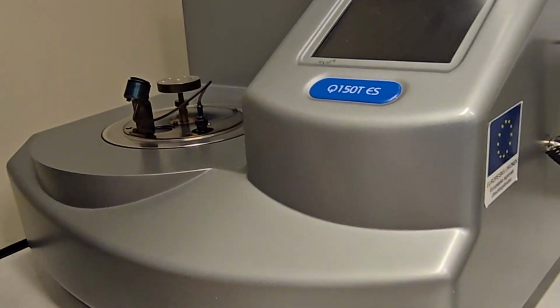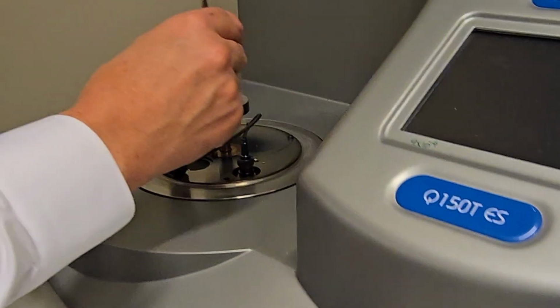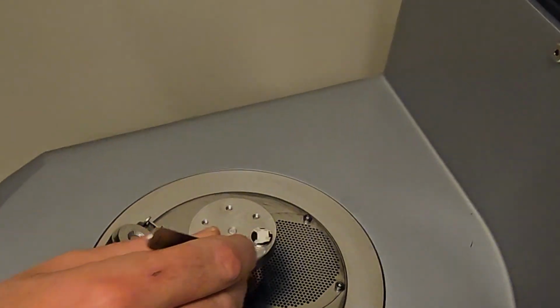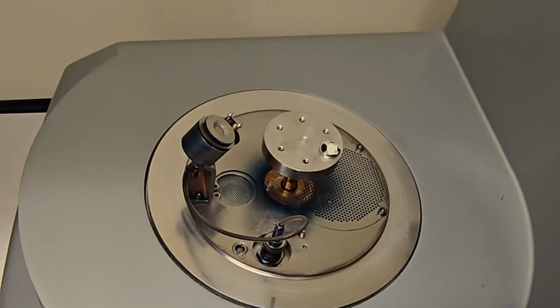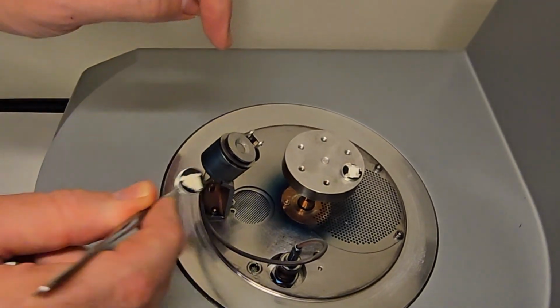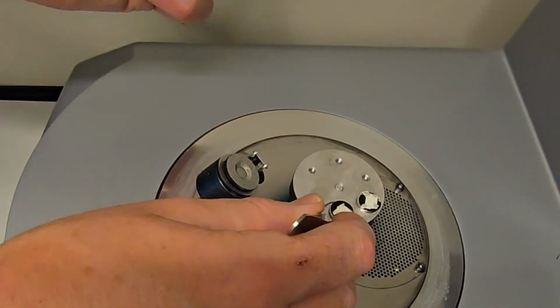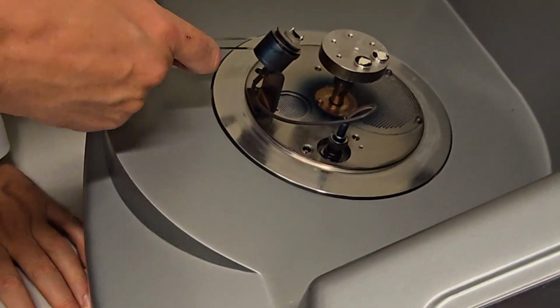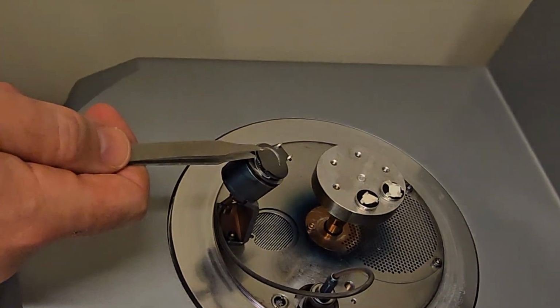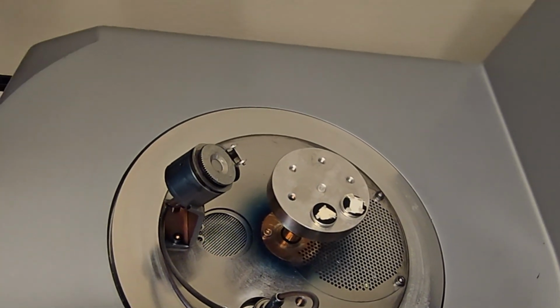So step 1 is to mount the samples, right? We have nice samples here prepared. Put them up here into the carousel. And since this one rotates, if your samples look very much the same, then it is good to mark them underneath, so you don't get confused when they come out in a different position. Check also that the lid here is not closed. It should be open. Otherwise we cannot measure the thickness, right?